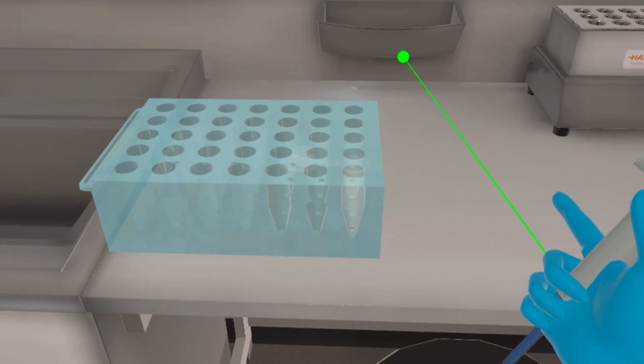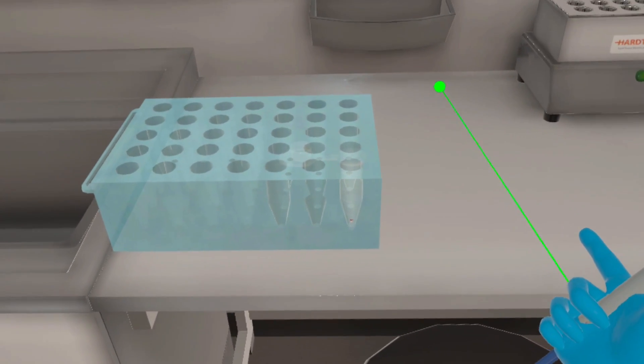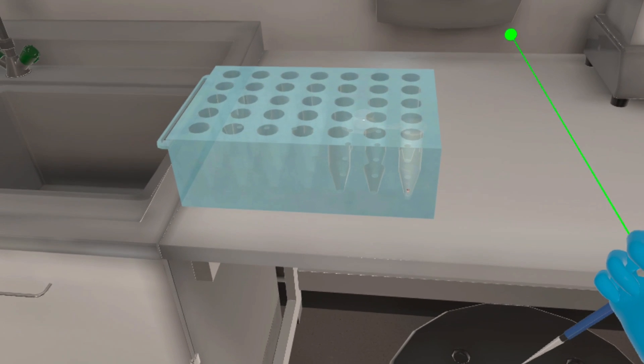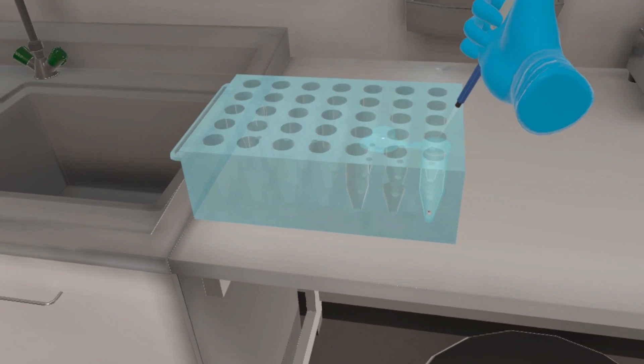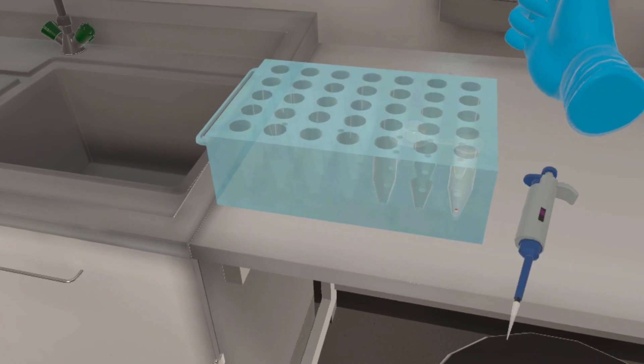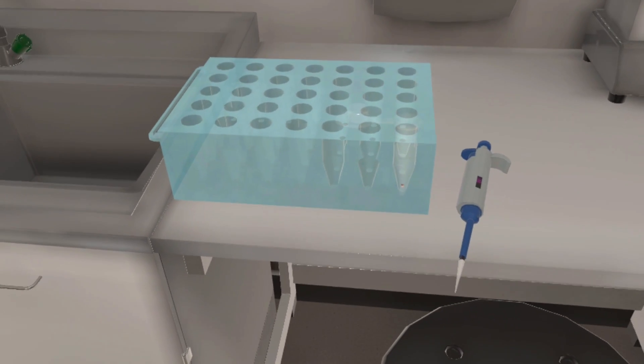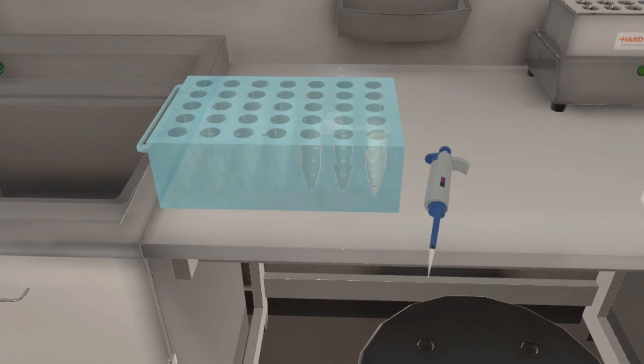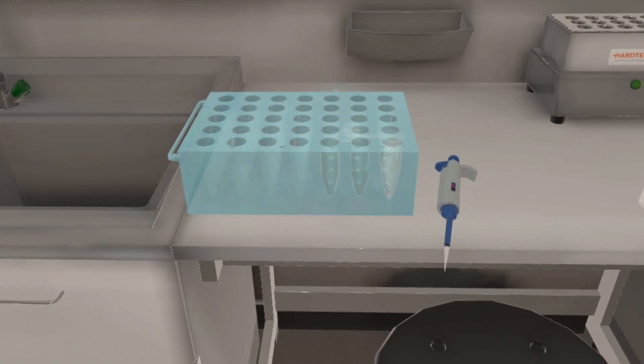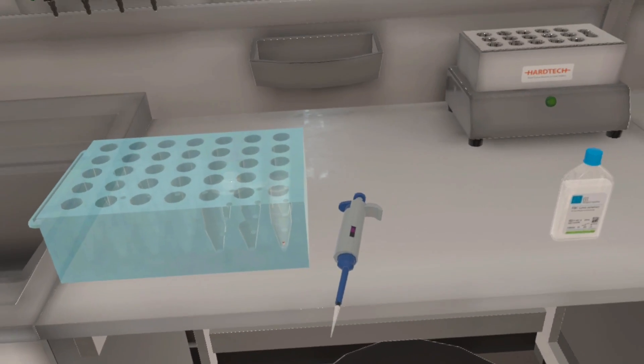Collide on the highlighted Eppendorf to empty the lysis solution in the Eppendorf and let it sit for some time. This sample will next undergo the process of DNA quantification, amplification, and profiling, which will help us in identifying the culprit.